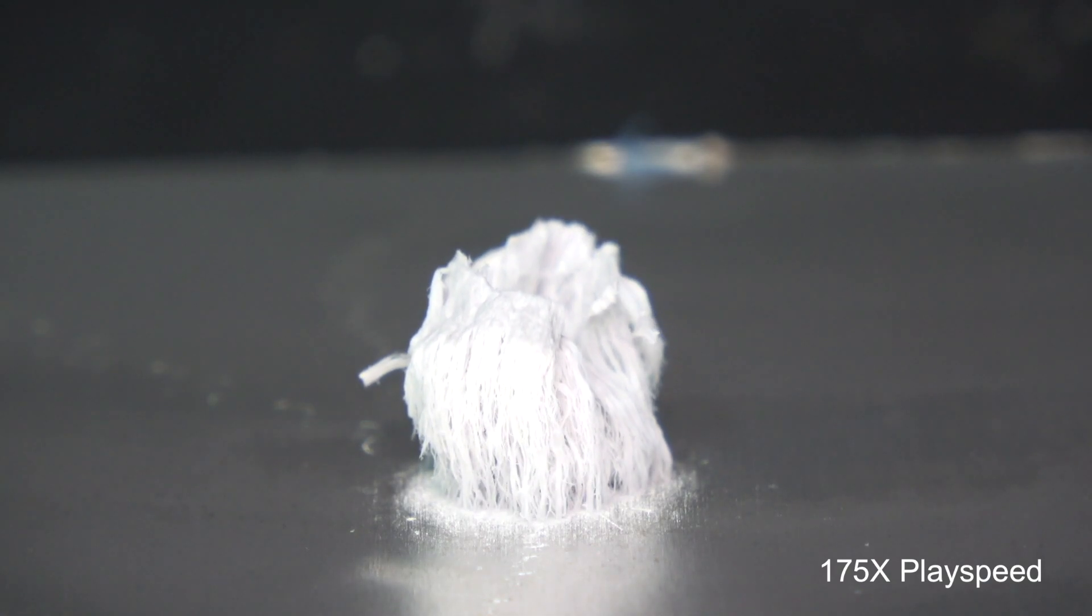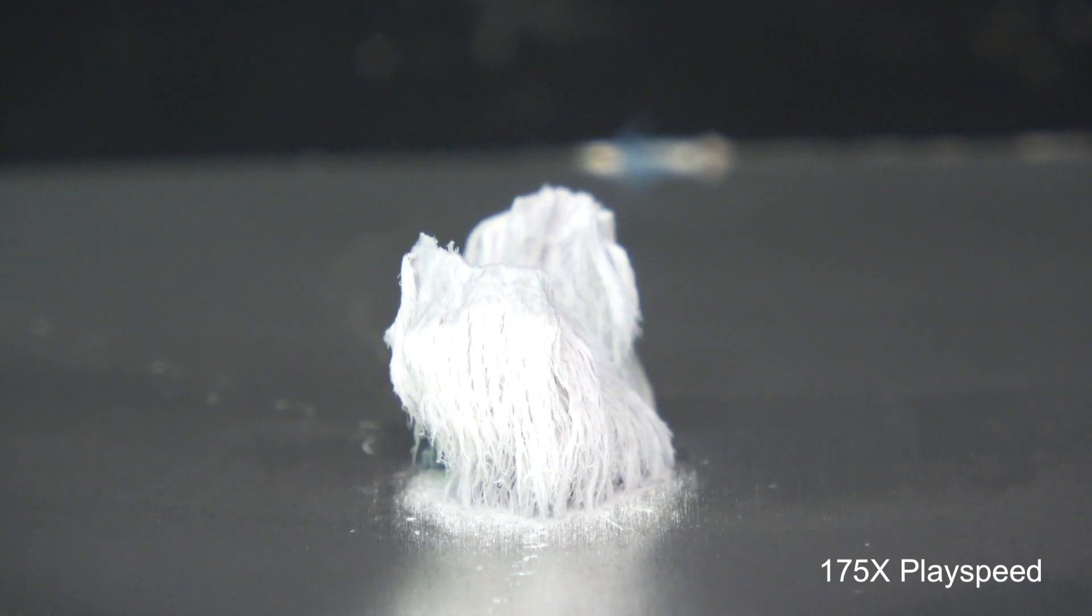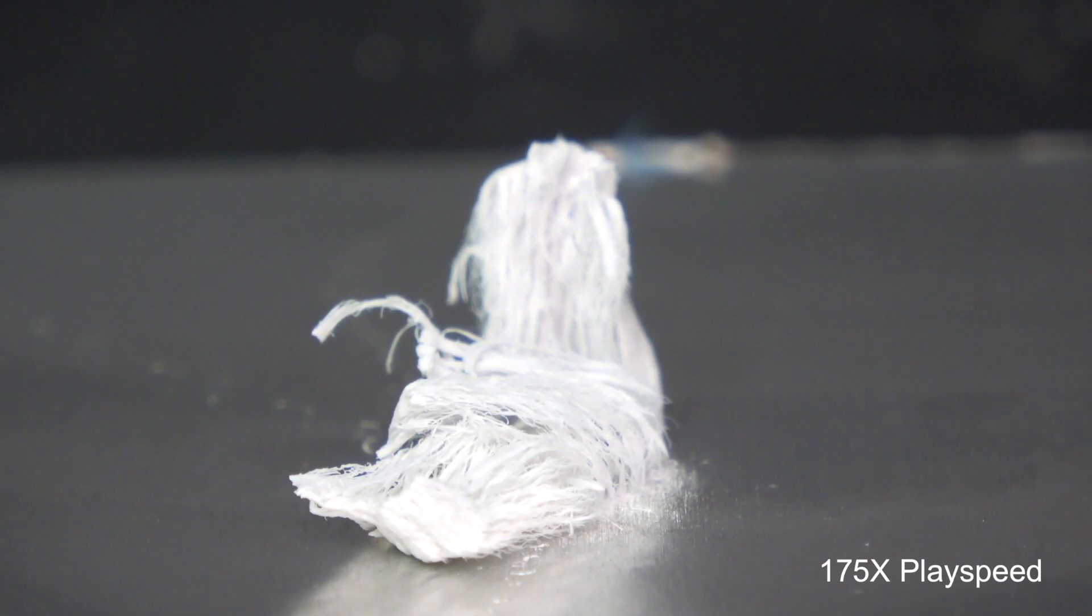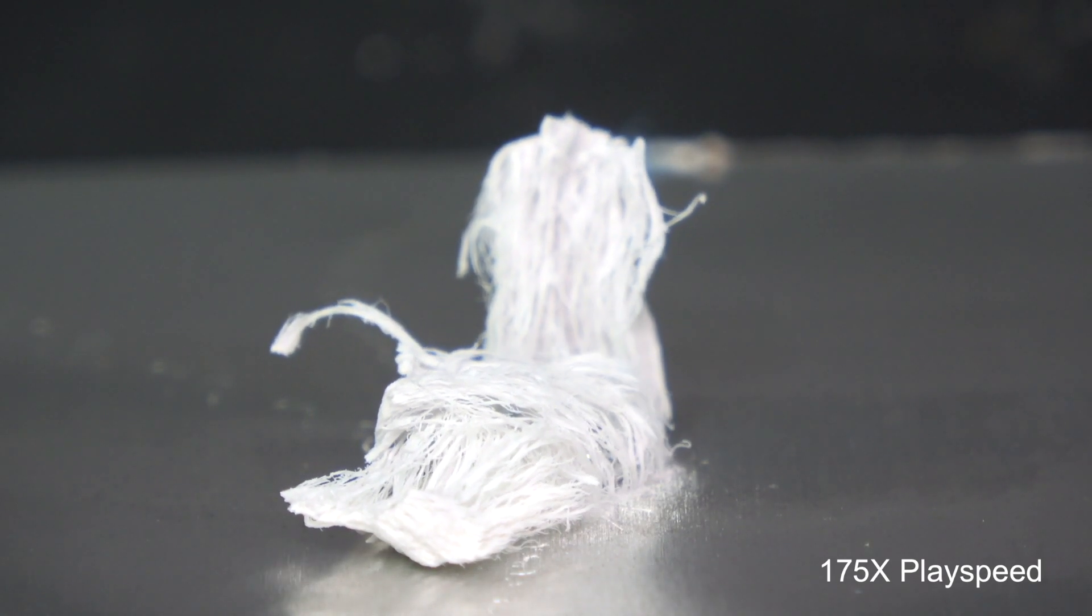In case anyone wonders how strong the structure is, you will be surprised how fragile it is. As it continues to grow, it will eventually collapse upon its own weight.